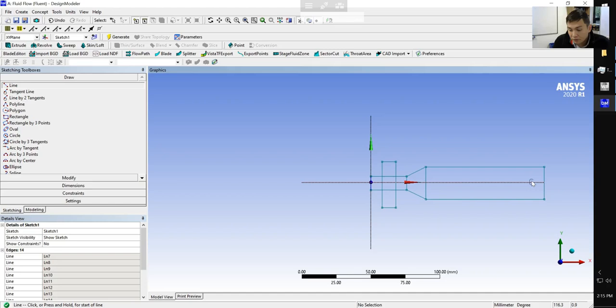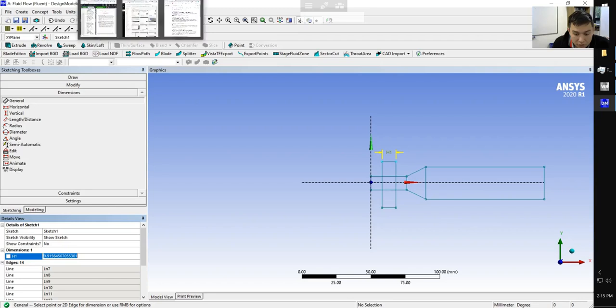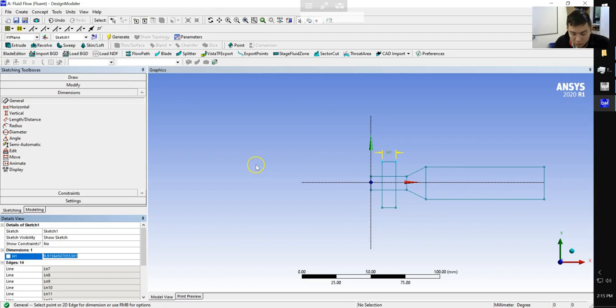Okay, so we've created a rough sketch of the system, but now we have to settle in on some of the dimensions. The width of each of these inlets is going to be 1/4 of a millimeter. So I guess this is quite large relative to what I wanted. Let's just make sure I've got my dimensions set. So yes, I want it to be 1/4 of a millimeter. So all of this is well oversized, so we have to be a little bit careful here that we don't lose track of things. This is going to be 0.25 wide, and so you can see just how important it is to zoom in.